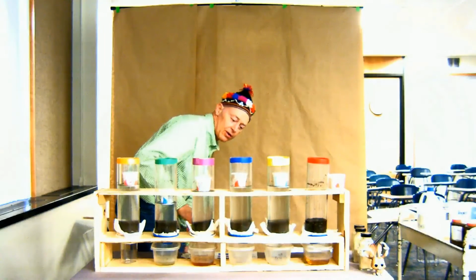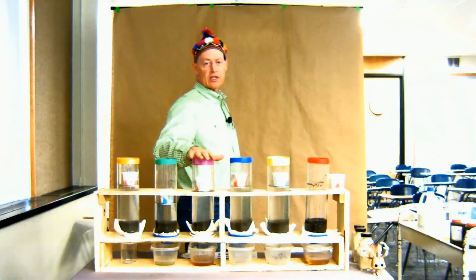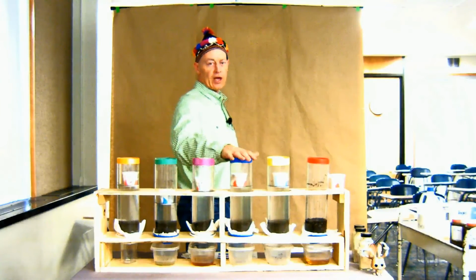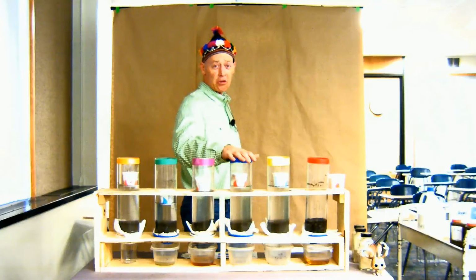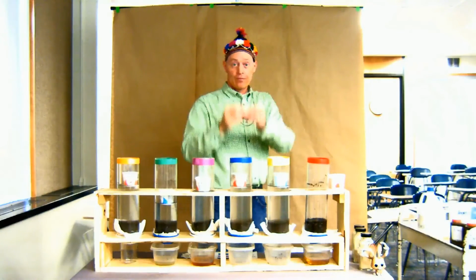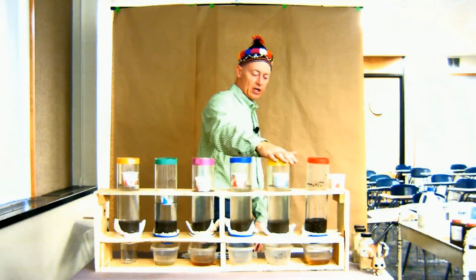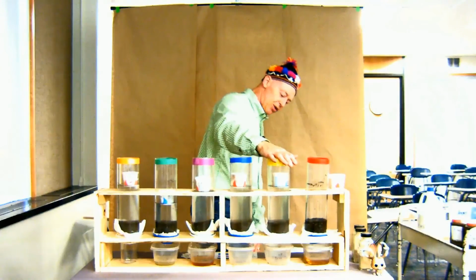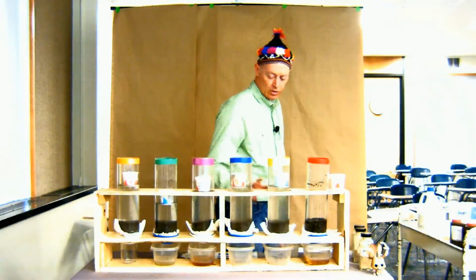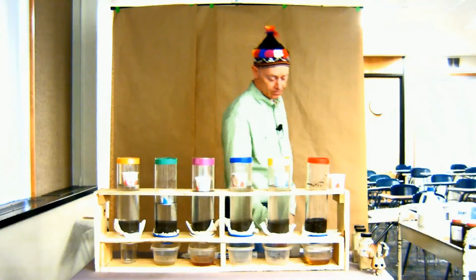Look at there. This is the pelletized gypsum. Remember, we had millions of little particles in the powder, and we had probably 20 pellets total. So unless those pellets are all lined up in a column, we probably won't see much water movement. This one is the spent lime. As you can see, we don't have, well, you may not be able to see, but we don't have any water that's moved through either one of those.